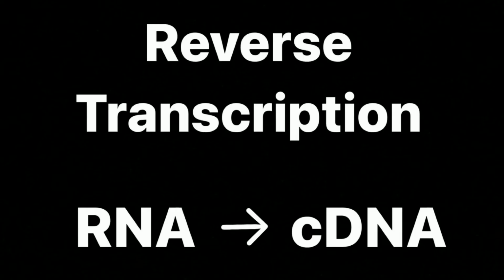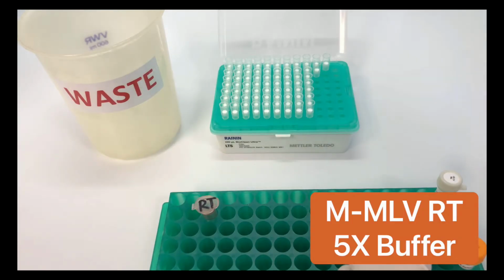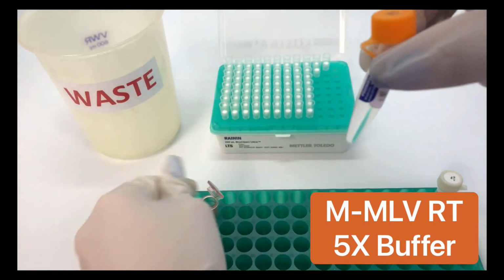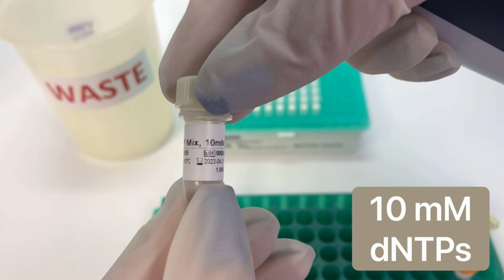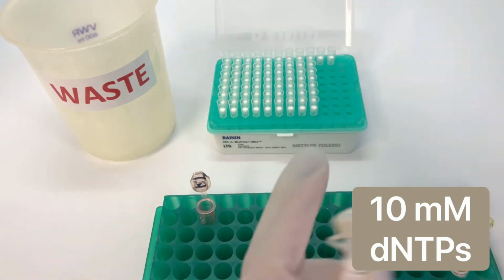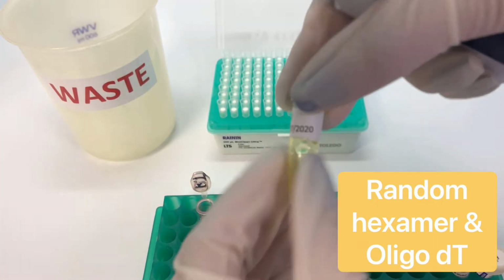Now we are ready to do reverse transcription. First, we will make our RT master mix. The volumes will be dependent on how many samples you have. Start out by adding the RT 5X buffer. Next, add the 10 millimolar dNTPs. Next, we are going to add our random hexamers and oligo-dT.